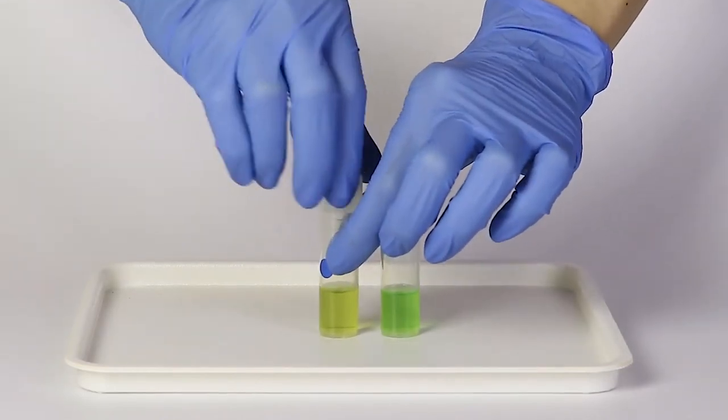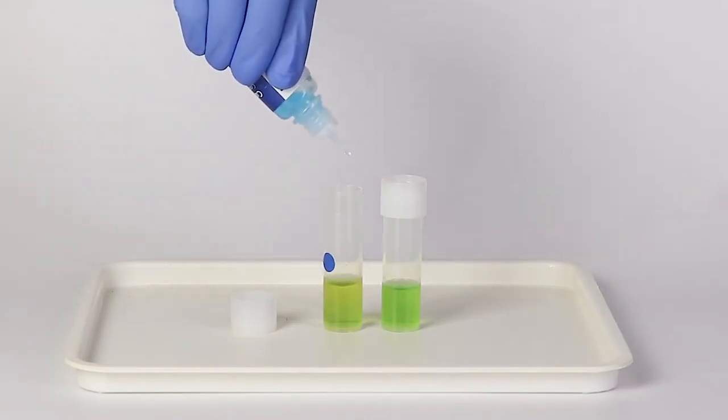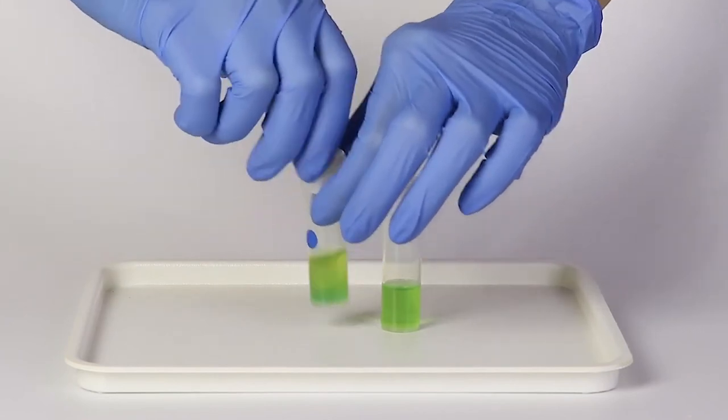Now open the vial with the blue sticker and add 10 drops of copper sulfate. Close the vial again and shake it.